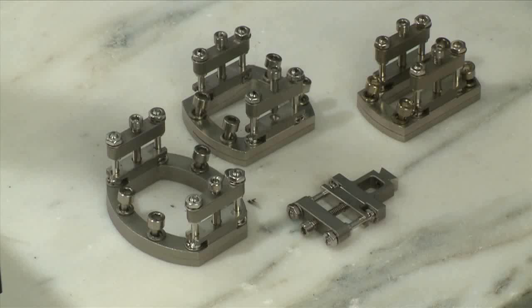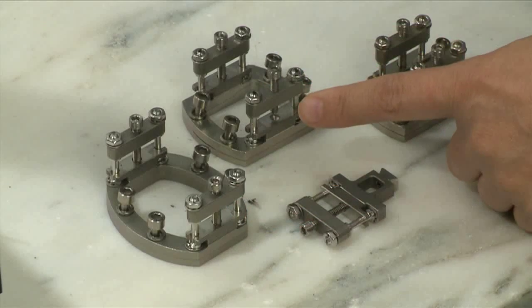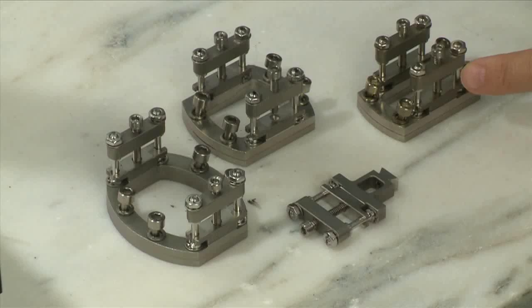This TA Tech Tip is going to show you how to calibrate the Q800 Dual Cantilever Clamp. TA Instruments offers three sizes of dual cantilever clamps: 35mm, 20mm, and 8mm.